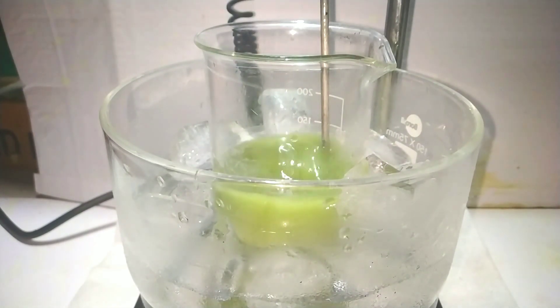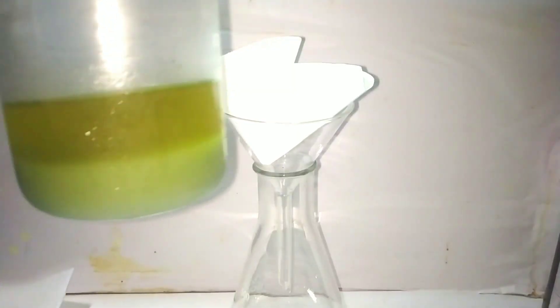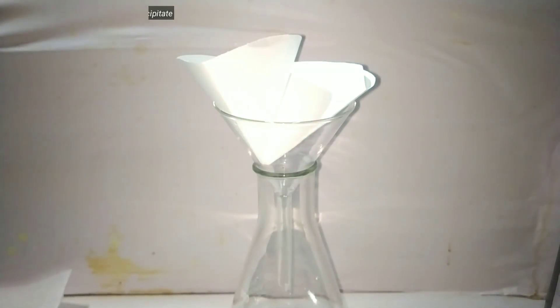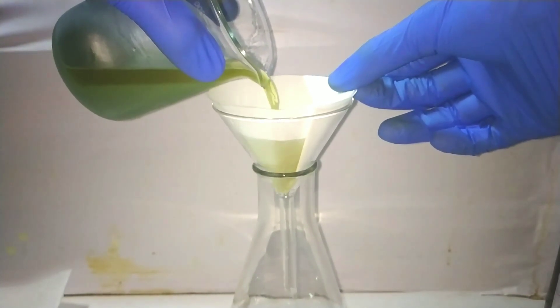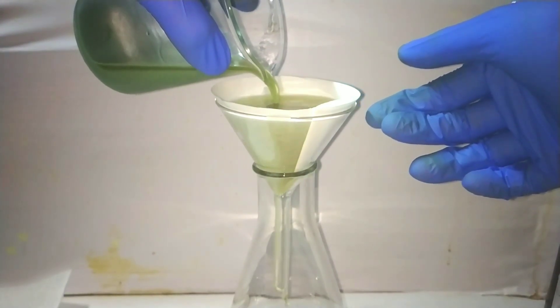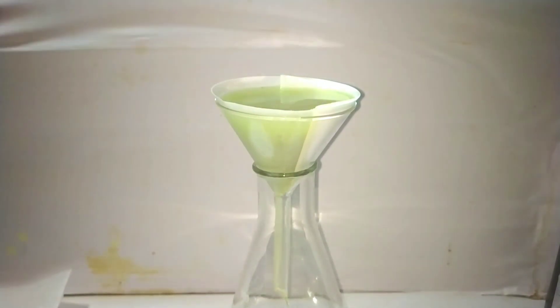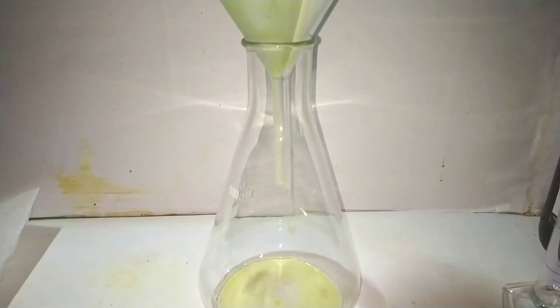After allowing it to sit for some time, we can see the white precipitate of sodium carbonate settling down at the bottom of the beaker. Now we have to filter this solution to get rid of the sodium carbonate. A vacuum filtration will be much easier in this case as the particle size is very fine and it will easily clog the pores of the filter paper. Once filtration is done, we are left with the sodium hydrogen sulphide solution in the filtrate, which is our reducing agent.